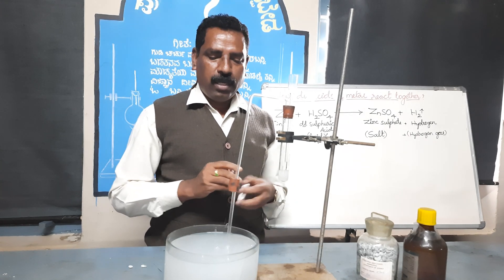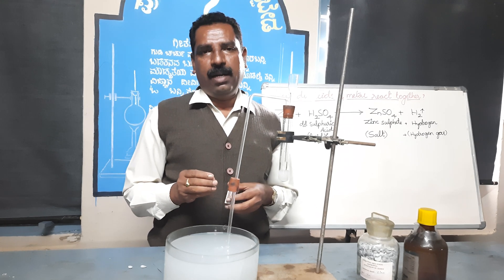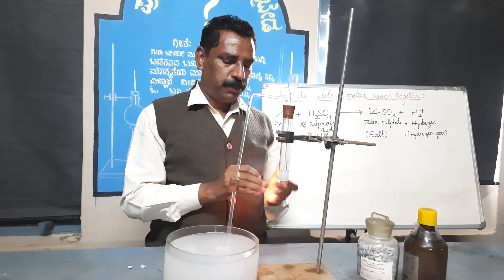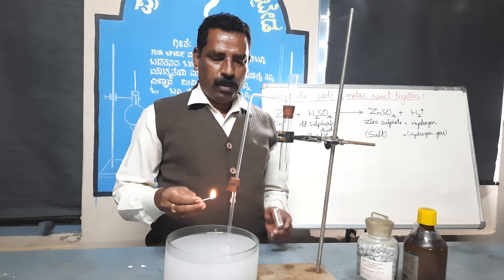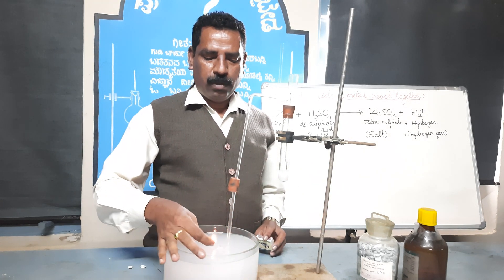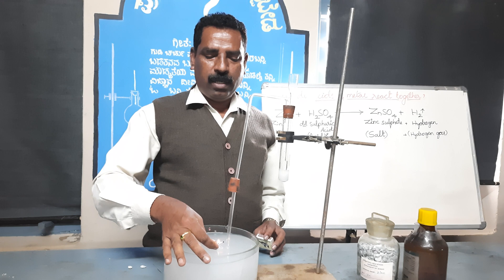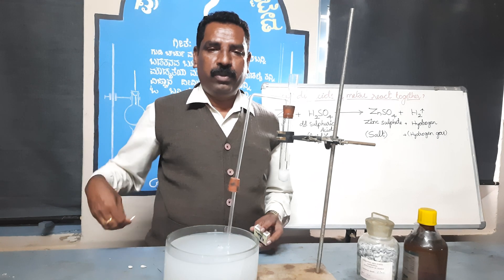It is tested either by burning a candle or by burning match sticks. What we will observe? The hydrogen burns to produce a pop sound.